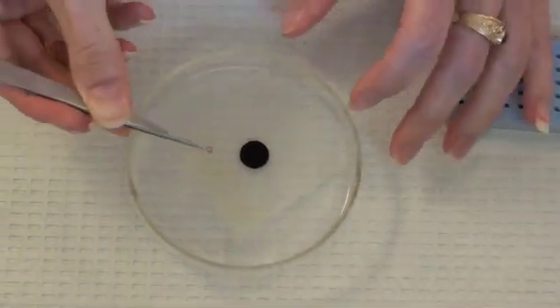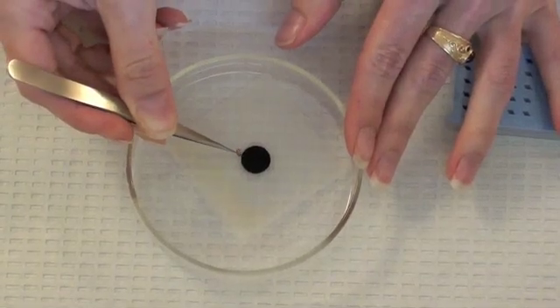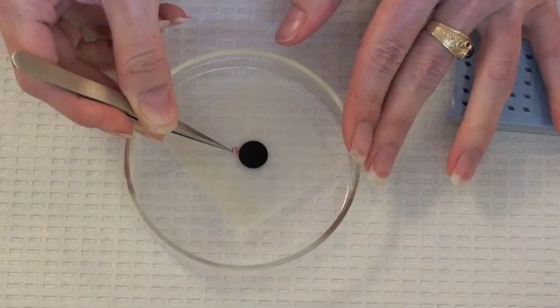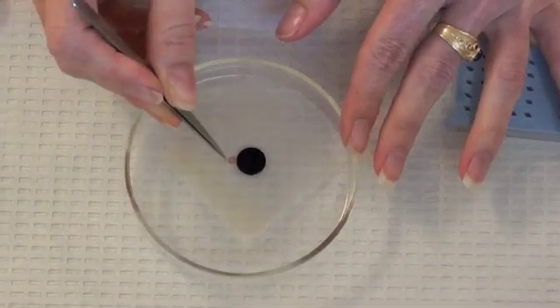Here's a second view of the same work. Here we see the TEM grid being stuck to the side of the PELCO tab. This PELCO tab will hold the grid in place while you add your sample.